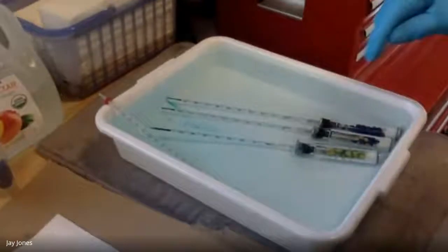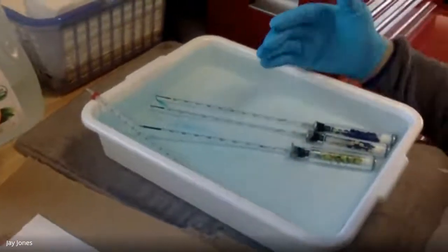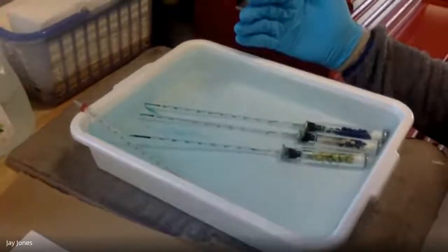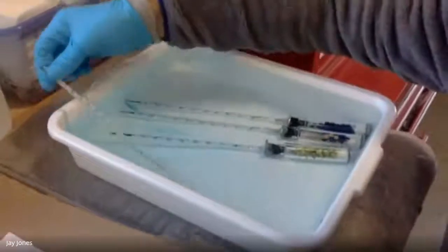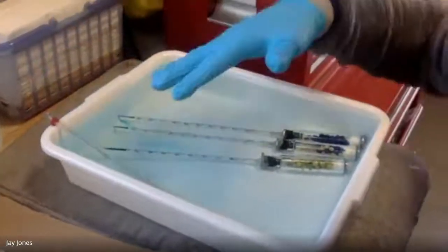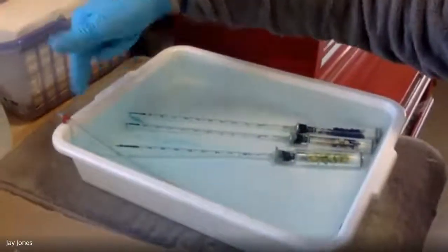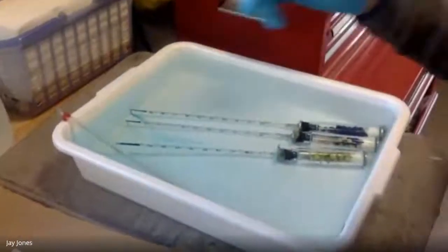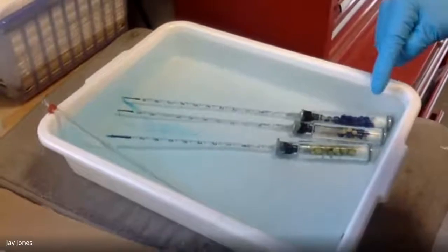So I'm going to stop the video in a couple seconds, guys. Just to summarize, everybody out there who's watching, this lab has 6 of these vials. I'm only doing 3 just because I'm doing it from home in my garage. Period 1 did the 25C. Period 9-10 with me today, they're being great, they did the 10C. It's the same exact setup, everything exactly the same. It's just that this is 10C. There are 3 vials: germinating peas, dry peas and beads alone.